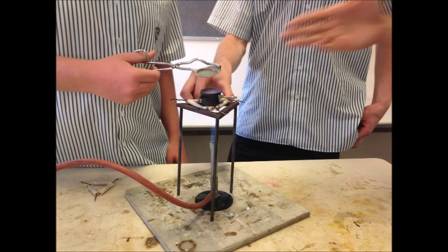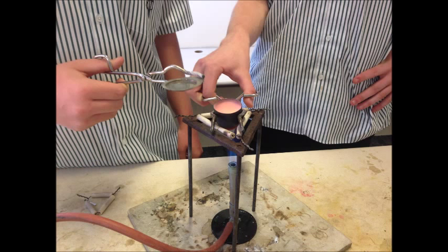The aim of this experiment is to compare the theoretical mass and the experimental mass of magnesium oxide produced when magnesium is burnt in air, and determine the percentage yield of the reaction. We're going to do this by using stoichiometry and performing the physical experiment, then comparing the data recorded.